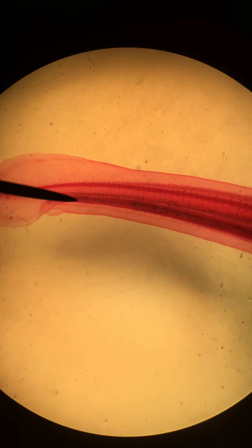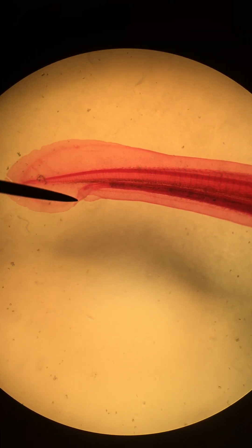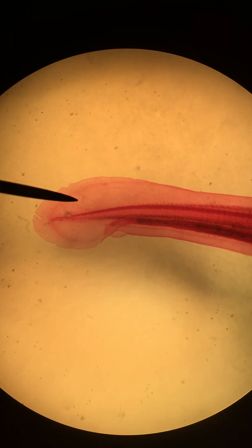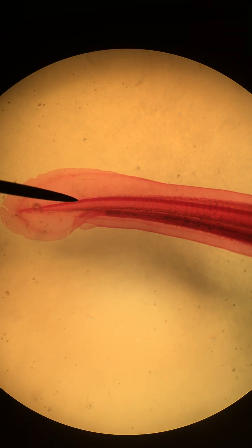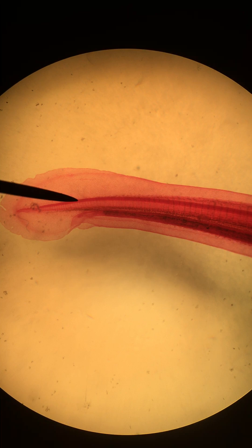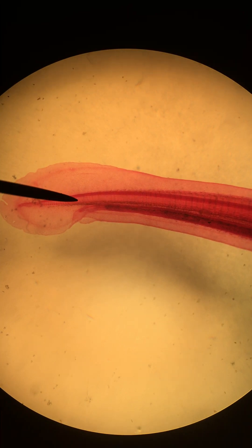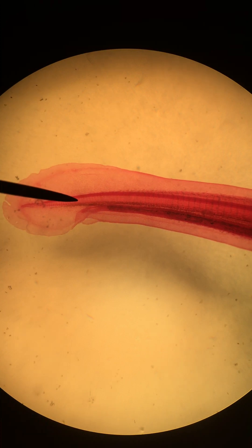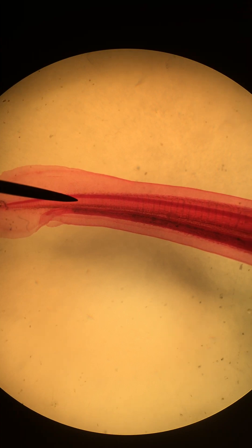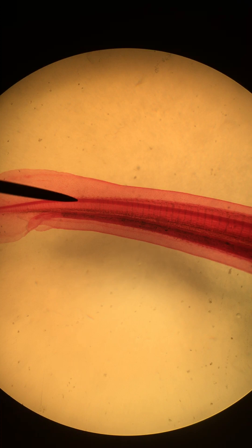The intestine runs down the ventral side of the organism, responsible for processing and digesting food, and it will terminate at the anus right here. And then we do have a post-anal tail right here. You can see the spinal cord where the pointer is now, and the notochord running the entire length of the body, head to tail — all of this is notochord, and just behind that the dorsal nerve cord or spinal cord.